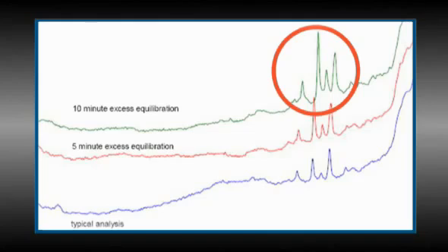We can repeat this experiment to ensure that the blank chromatograms can be duplicated, indicating that the buildup is reproducible, which it should be. This series of experiments showed that the impurities originated from some trace impurities in the mobile phase, building up with increase in equilibration time. From these results, however, we cannot really tell which of the two mobile phase solvents the impurities were present in, so each may have to be further investigated, as was discussed earlier.